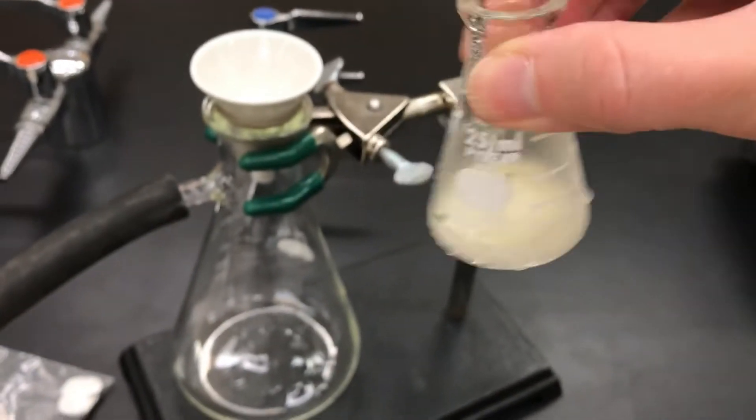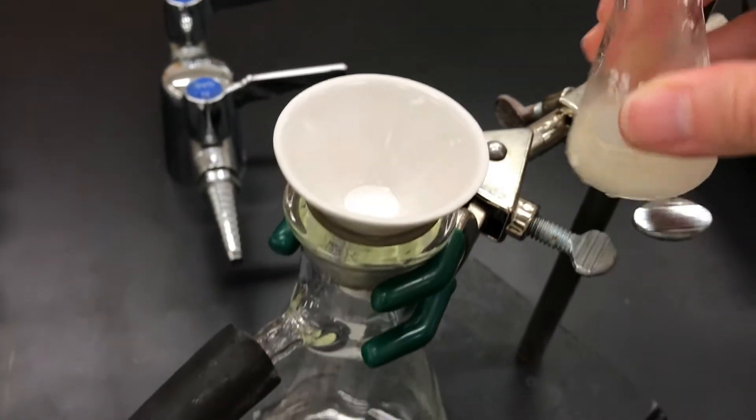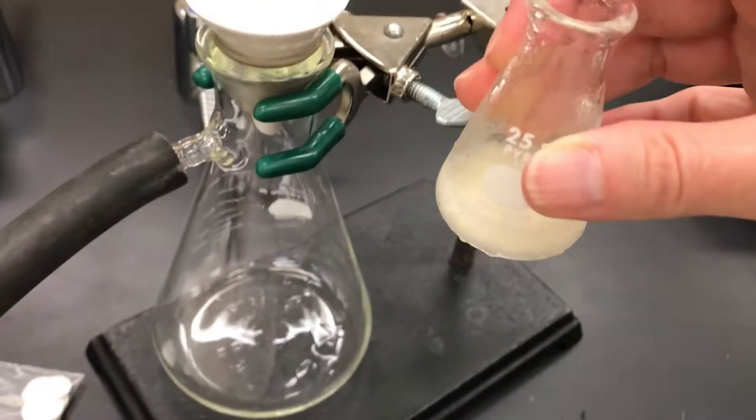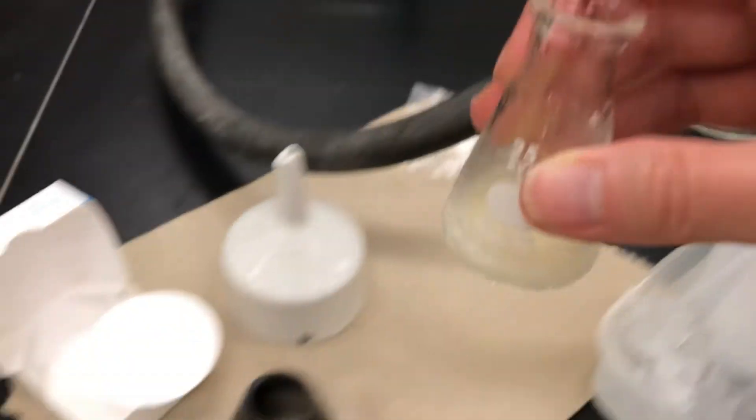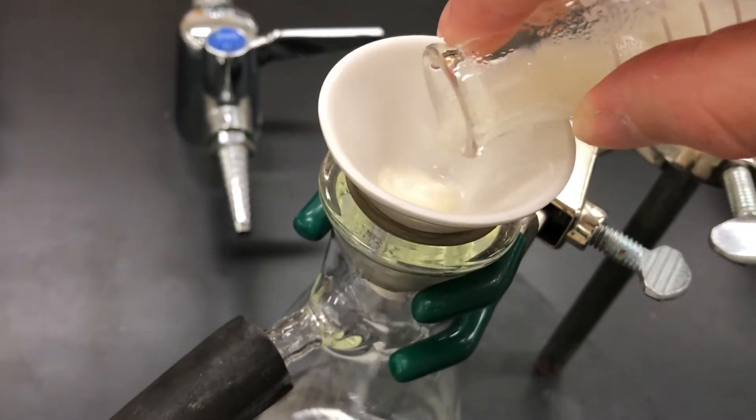So I take my solid liquid slurry, and I just noticed that the bottom is quite wet, so I don't want to pour any of that in. So I'm going to just dry it off first, but now I pour in the solid.